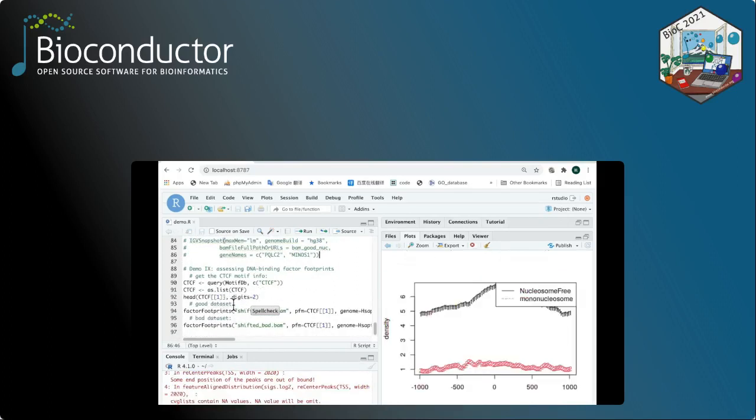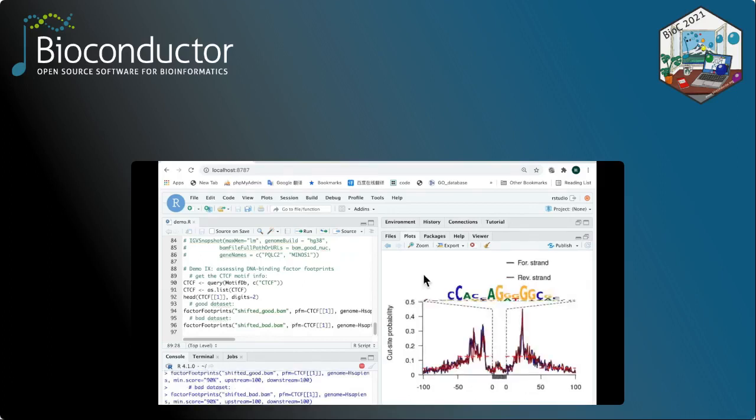And the last demonstration is about assessing the DNA binding factors. For this function, first you have to get the motif information and use the function factorFootprints to visualize the footprint of the transcription factor. Again, this may take a little bit longer to run, and we just have to be patient. Okay, now as you can see, the footprint plot has been generated on the right.